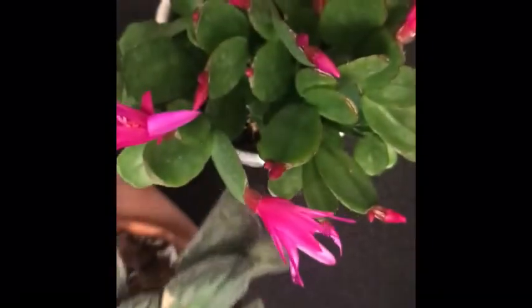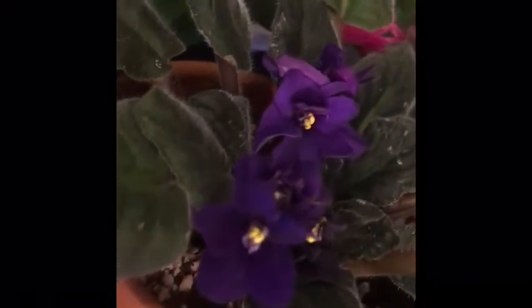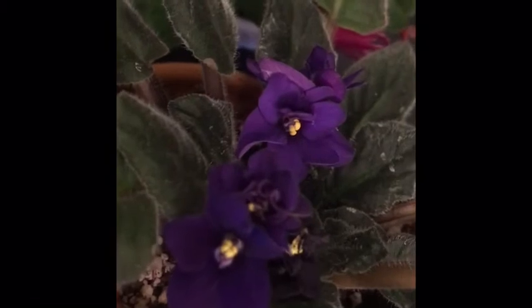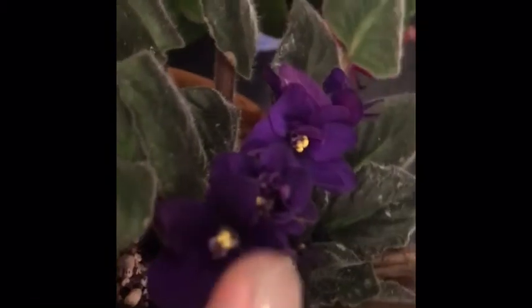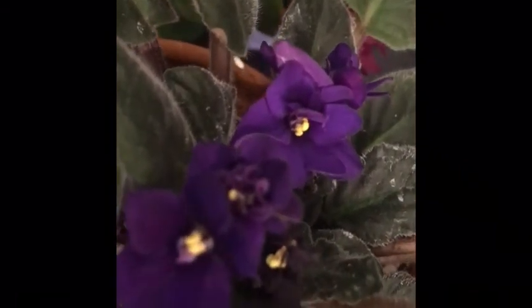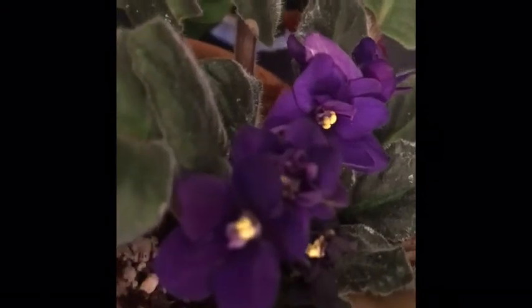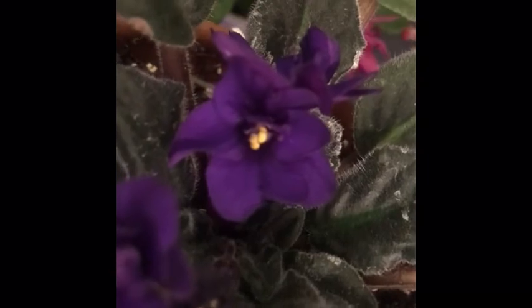And then we have a taller pistil. Here on this African violet, you see those yellow balls? That is where the pollen would be, and then there's a long tube which is kind of tricky to see just because of the color. It's the same color as the petals, but I'll post a picture of this too. And the long tube is that pistil.